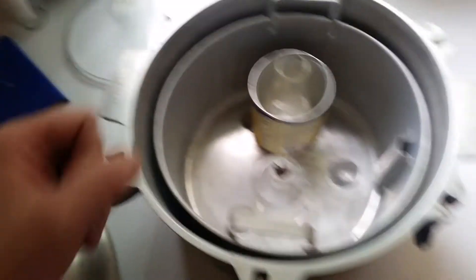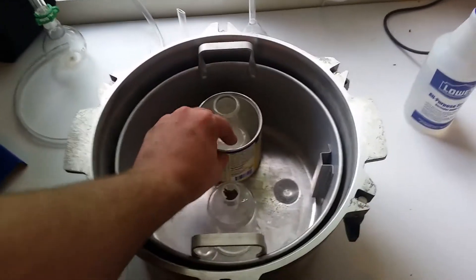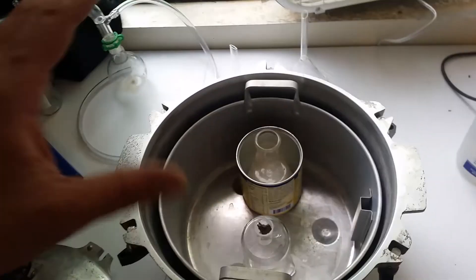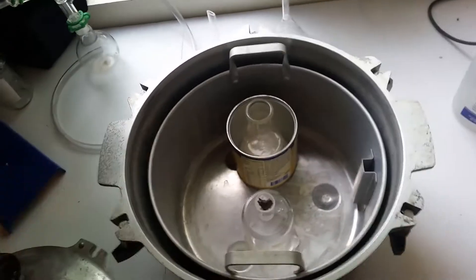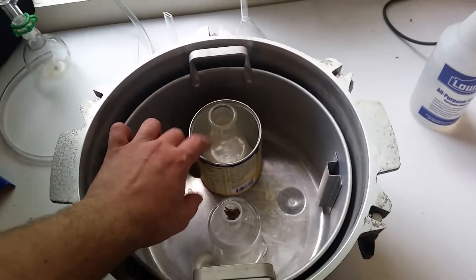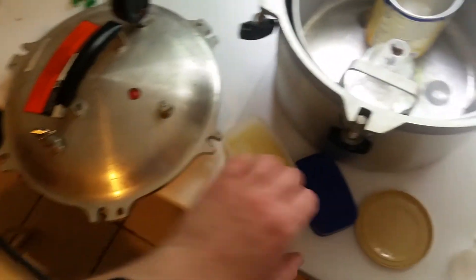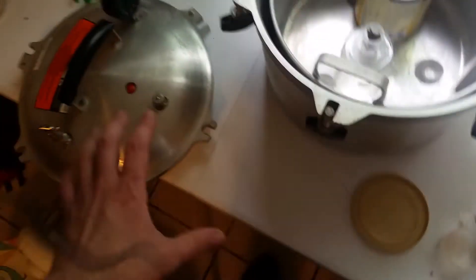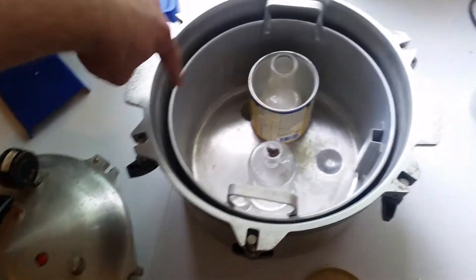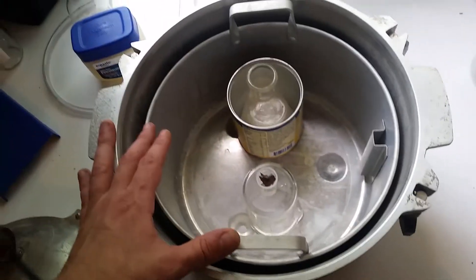Okay. So this is test number four. We got a lot more sodium hydroxide in here. Got more aluminum to throw in there. Because I expect a bit more of a reaction, I put it in kind of like a jar thing here. So that way if anything spills out it's contained, rather than corroding the rest of this aluminum. But in an effort to maintain pressure, I have covered the rim of this with a bit more petroleum jelly in the efforts to hopefully seal the edges up here a little bit better. It seemed fairly sealed, but it was obviously leaking.